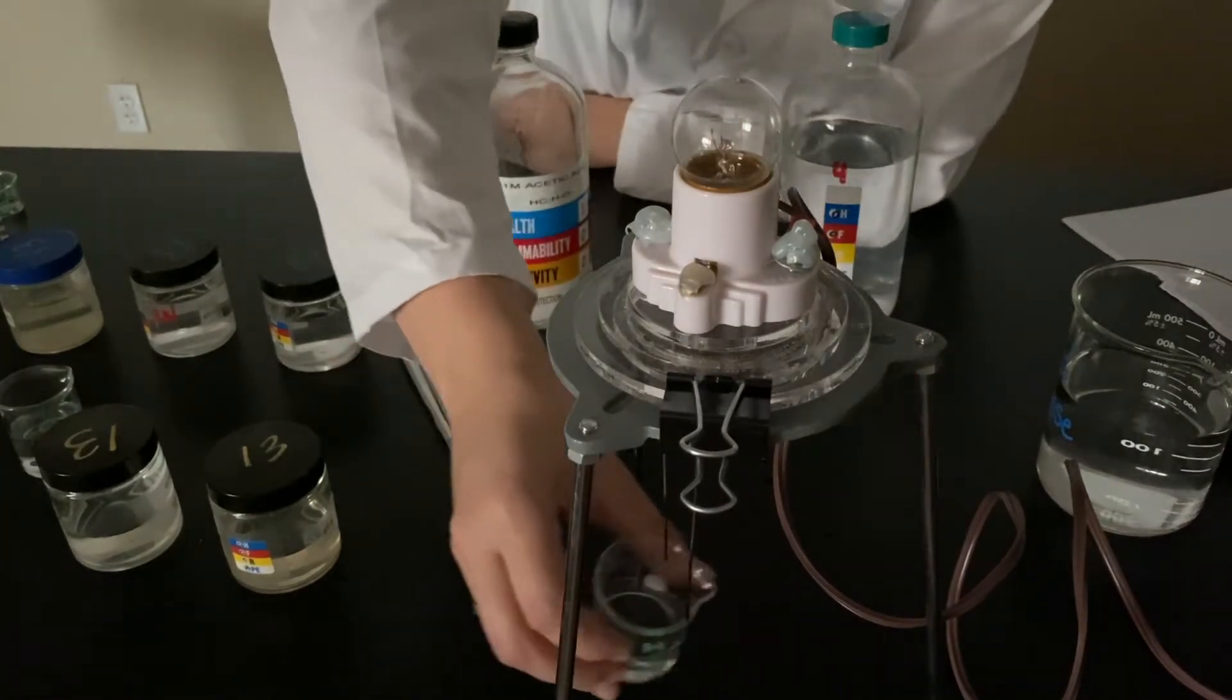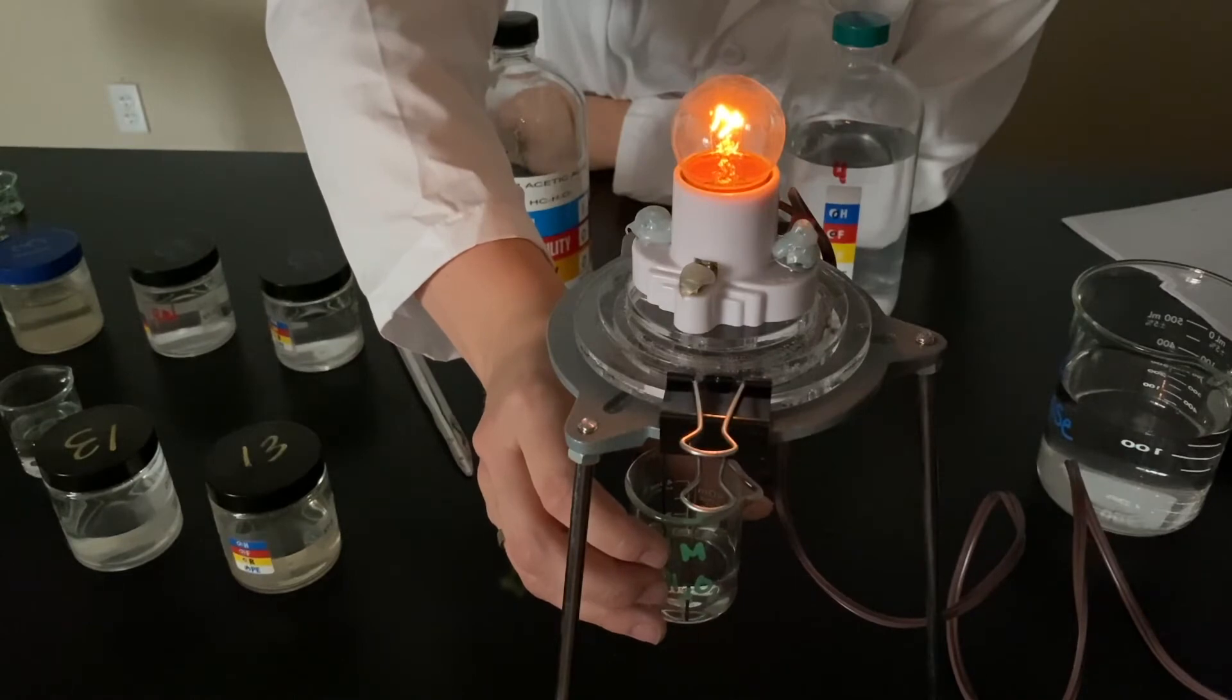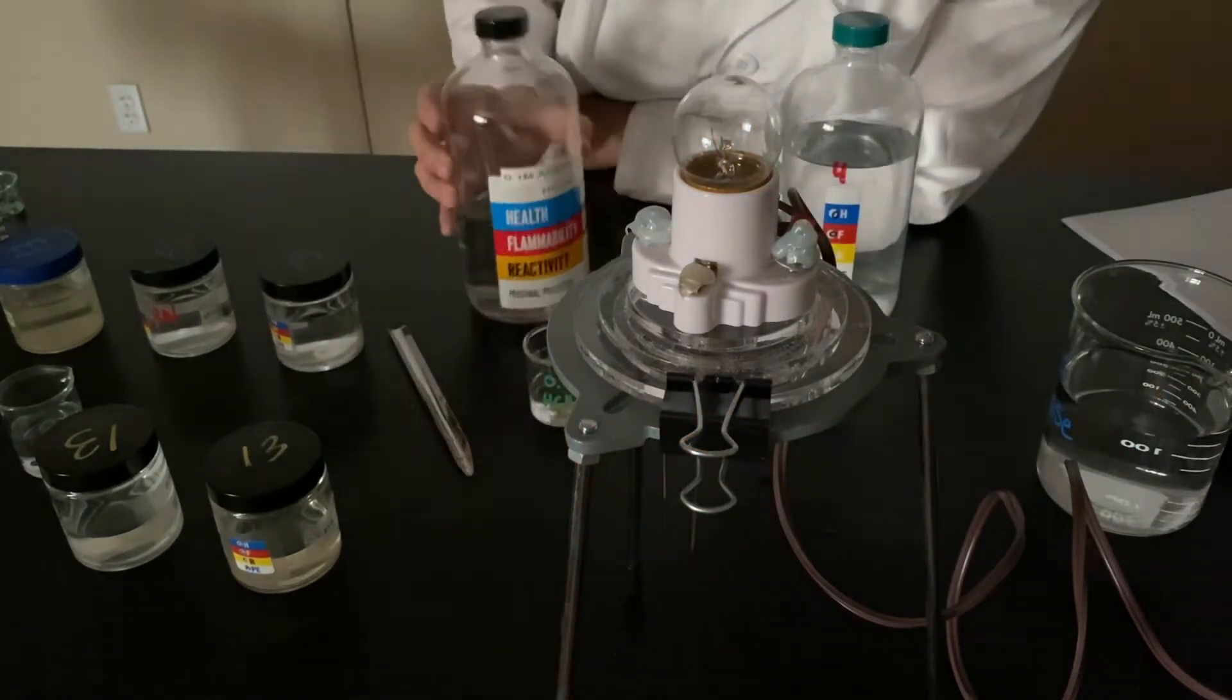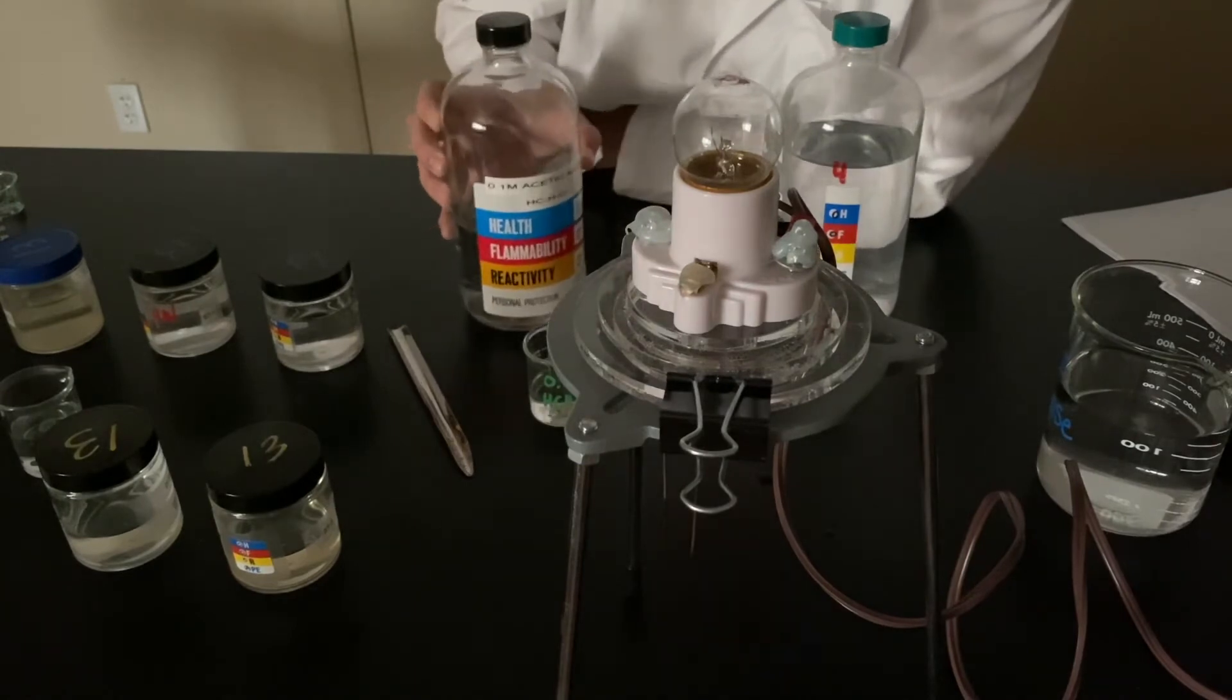Here's my acetic acid. That is 0.1 molar acetic acid.